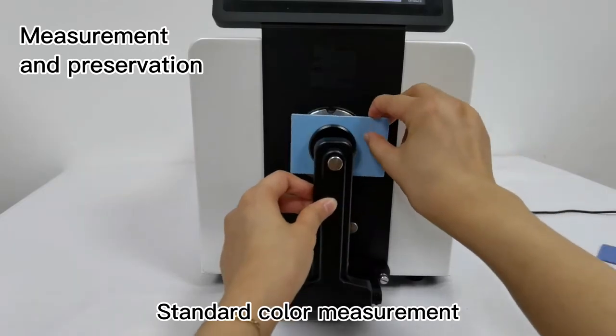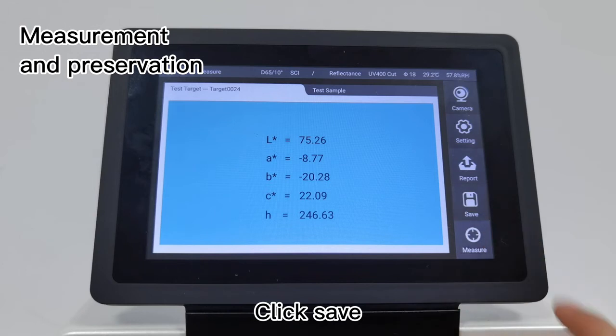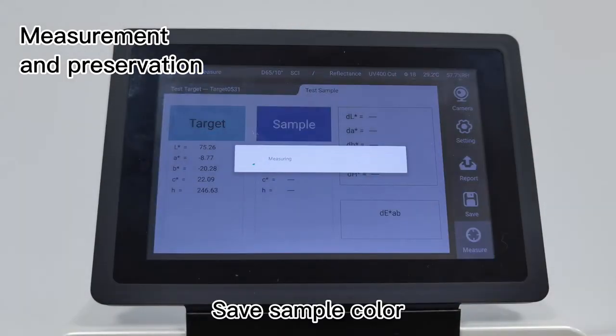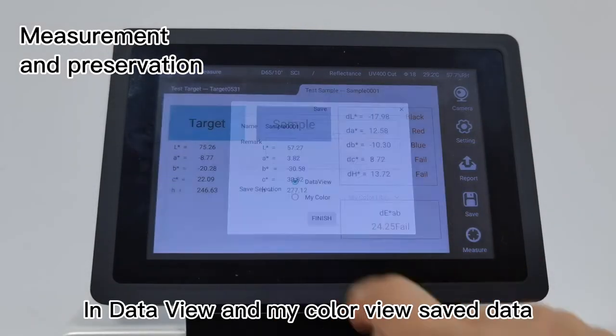Color measurement and preservation: Standard color measurement - click save. Colors can be saved to Data View and My Colors. Test sample, save sample color in Data View and My Color view to save the data.